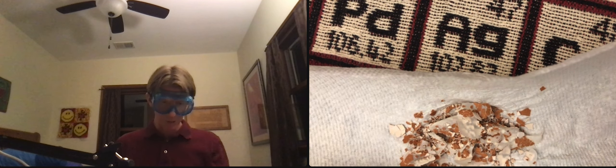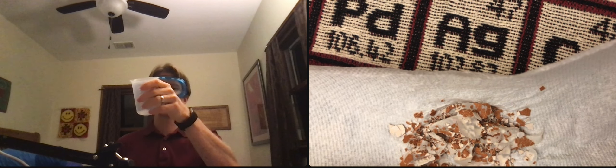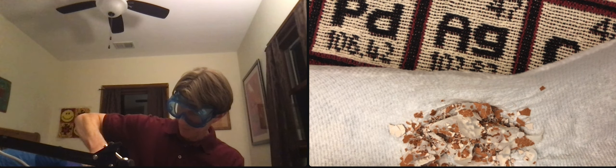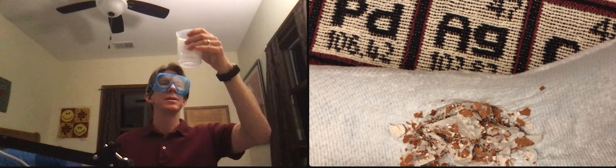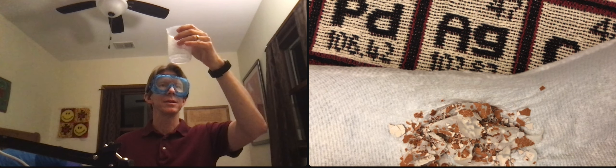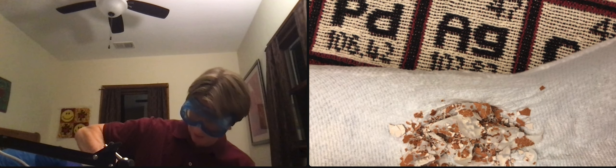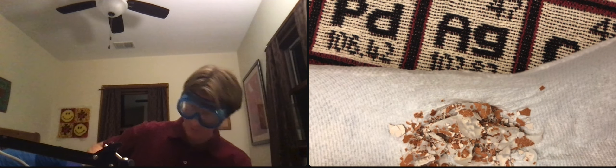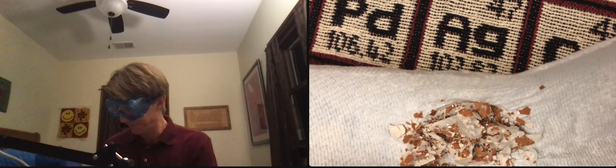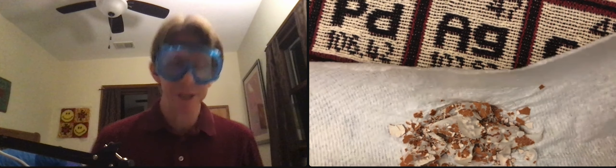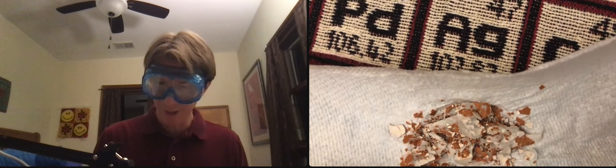I'm going to pour 25 milliliters in approximately. I know this doesn't go to 25 - oh yeah, it does. It's a little bit below the 25 line. I'm going to add a little bit more. These are beakers - we don't use them to hold accurate amounts of stuff. Let me zoom out and transfer as much of this as I can.